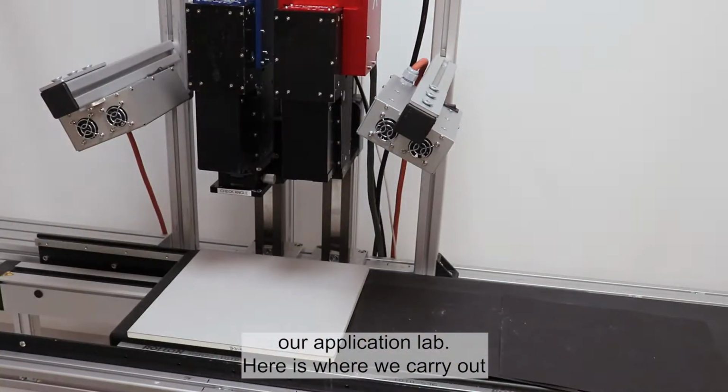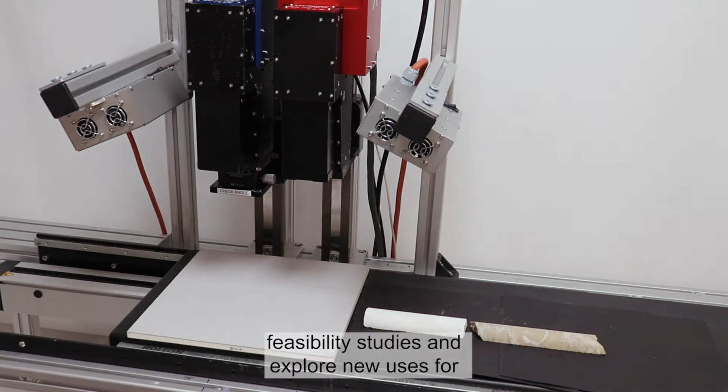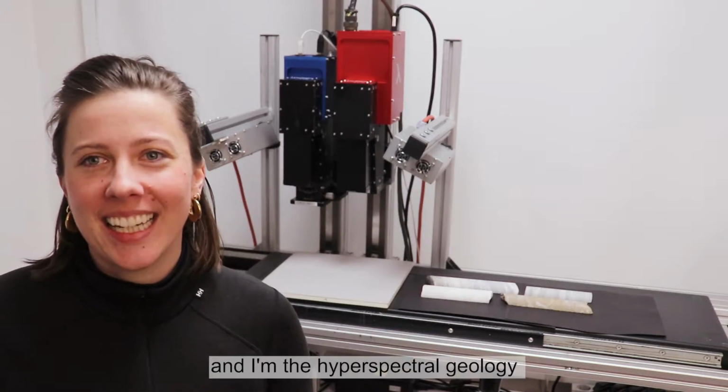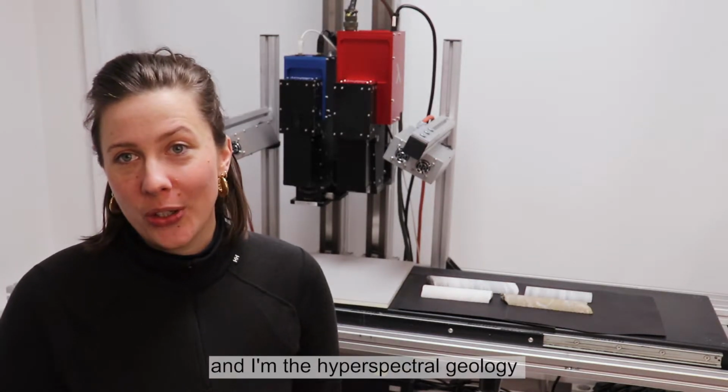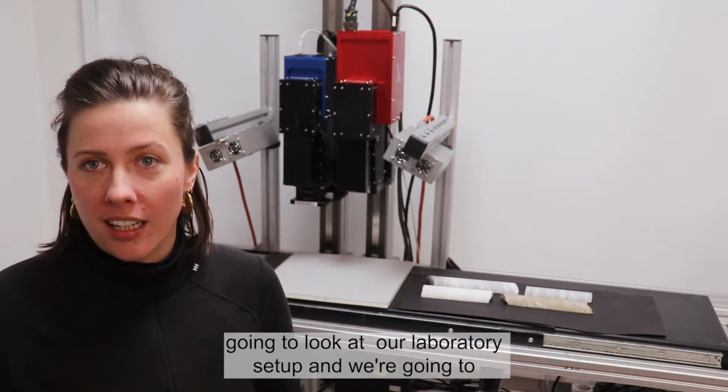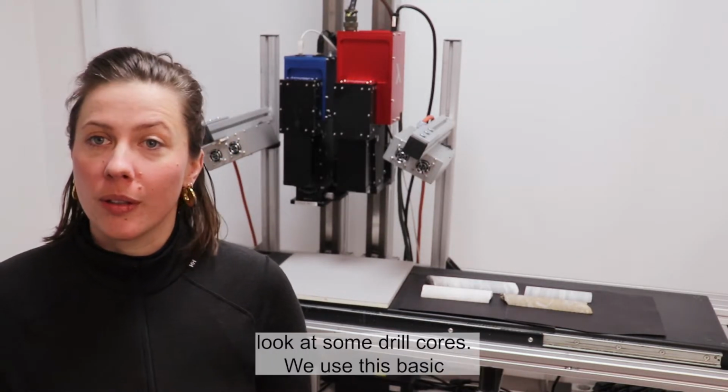Here is where we carry out feasibility studies and explore new uses for our hyperspectral cameras. My name is Friederike Körting and I'm the Hyperspectral Geology Application Specialist at HySpex. Today we are going to look at our laboratory setup and we're going to look at some drill cores.